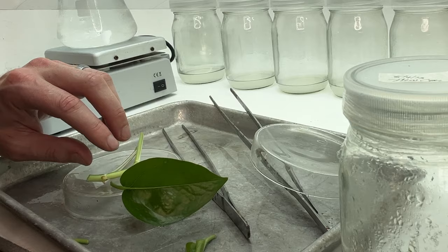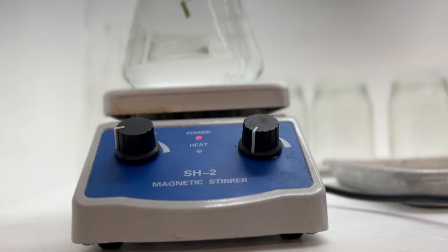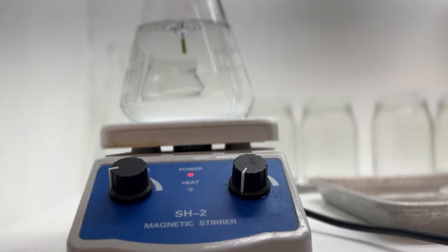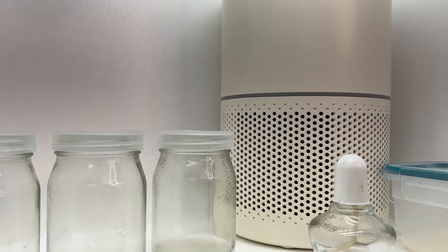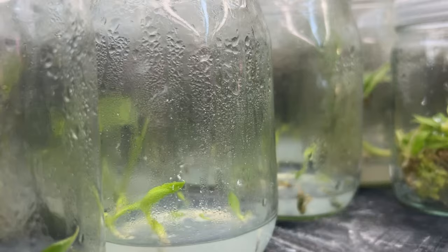The process begins with selecting a small selection of plant tissue, such as a leaf or a stem, and sterilizing it to eliminate any microorganisms. This sterile tissue is then placed on a nutrient-rich media containing essential nutrients and growth hormones. We will demonstrate this shortly.